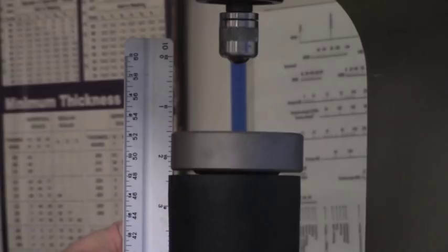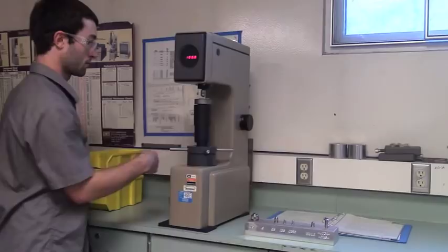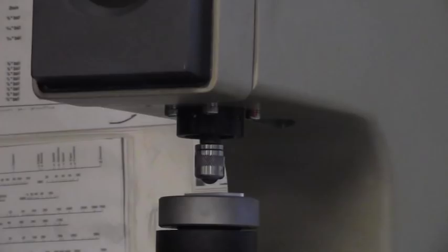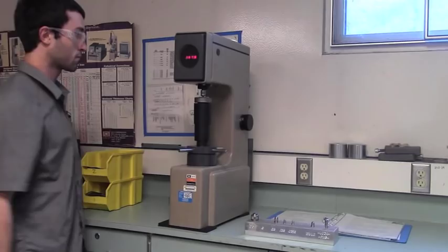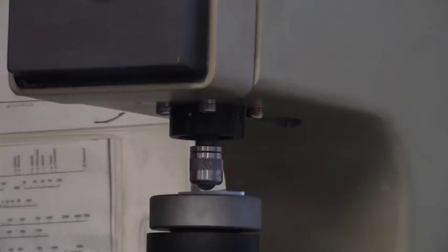Place your specimen on top of the anvil and begin to turn the handle, raising it at a medium to quick pace until an audible click is heard and felt. This indicates that the specimen is in the correct position and the machine cycle has triggered.